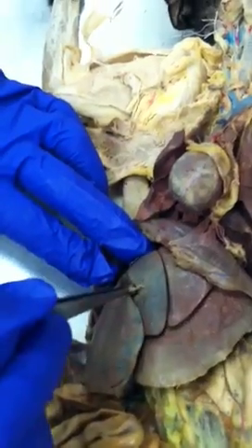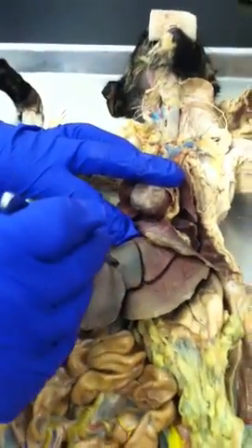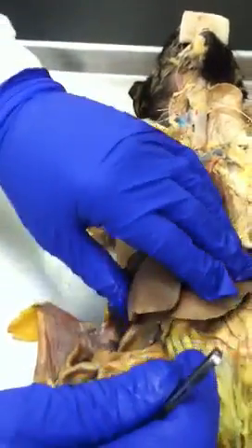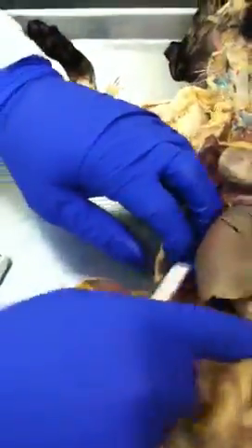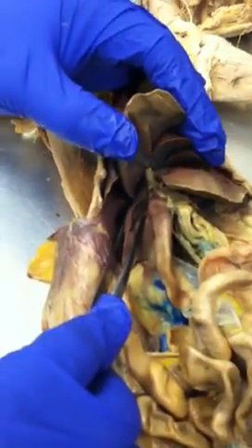And of course, this is our gallbladder in there. We'll go in there in a little bit to talk about those ducts and so forth, all right? So you see all this, the right median lobe, it's all that. This crack is just to accommodate the gallbladder, but it's all right median lobe. To look for the right lateral lobe, you kind of have to look for it because it's really on the side, and you go down there. You see these two here, down here? Can you see it with yours? This would be the right lateral lobe right here.